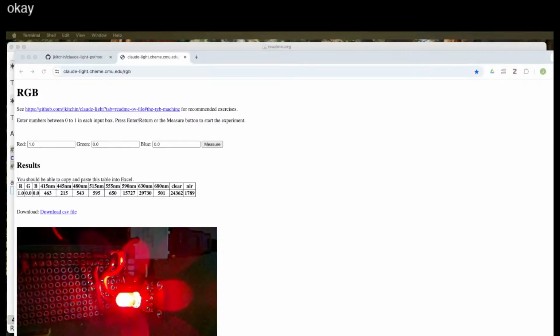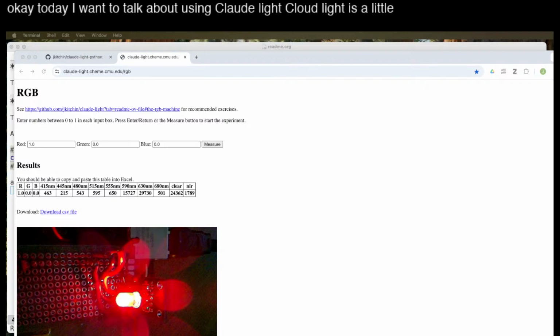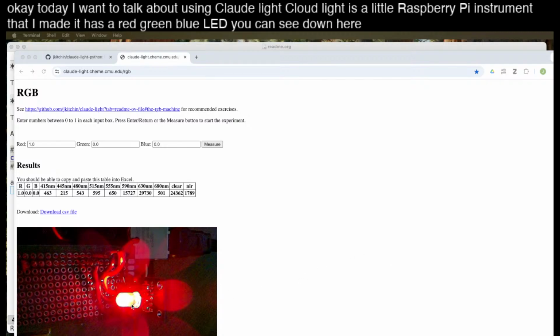Okay, today I want to talk about using Claude-Light. Claude-Light is a little Raspberry Pi instrument that I made. It has a red, green, blue LED you can see down here. And you can set this remotely by a web interface.